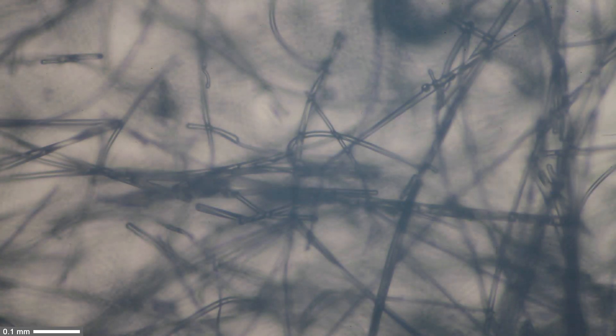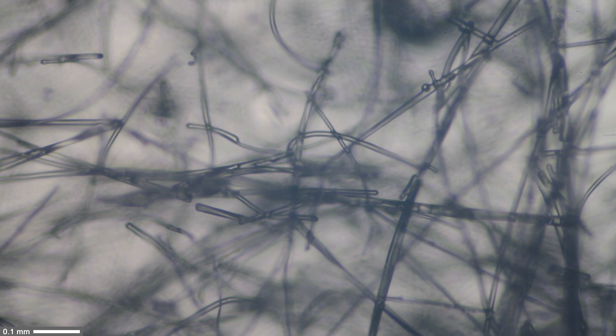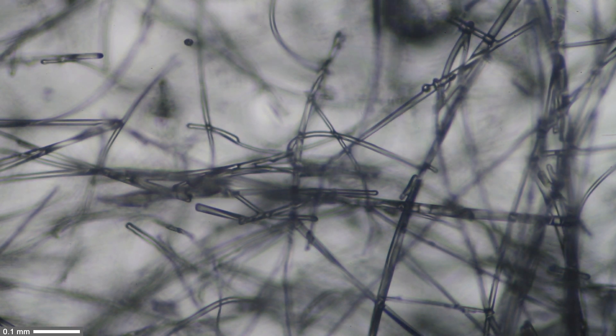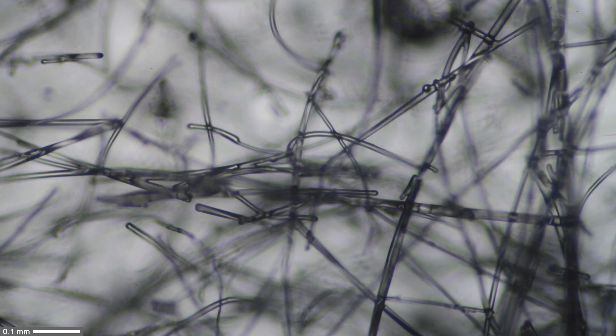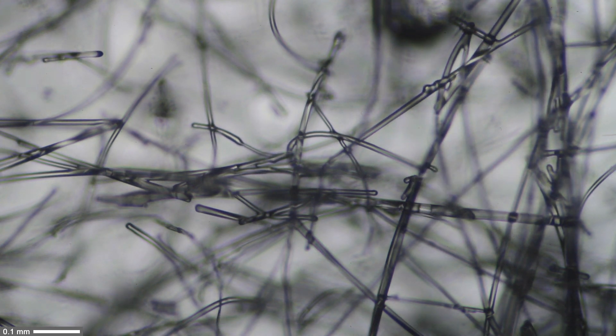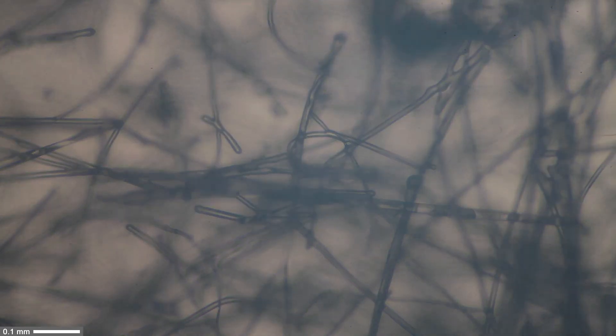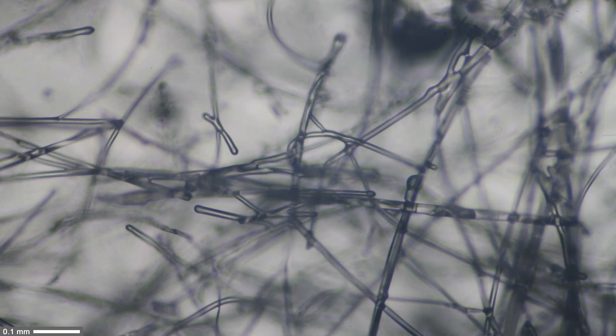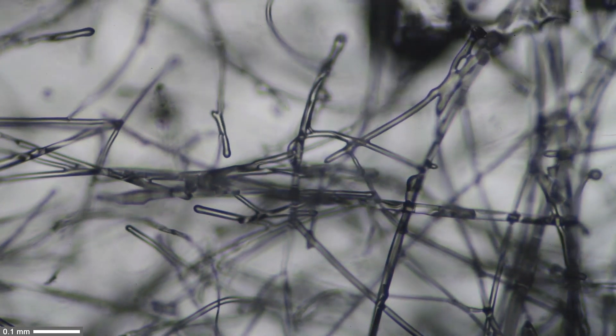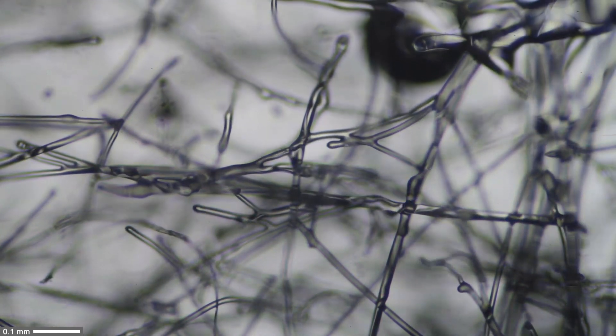I blew on the slide and you could see a little bit of fog because I added moisture. I wanted to observe under the microscope how the sugar actually dissolves and melts. I'm blowing again and you can see it was a little bit blurry. You see the fog again.